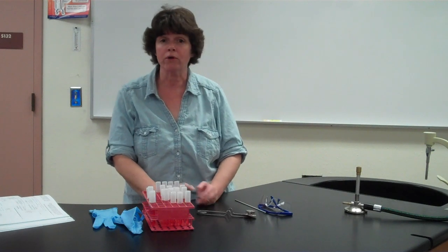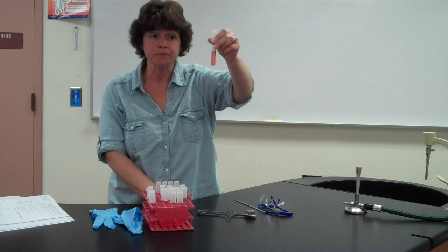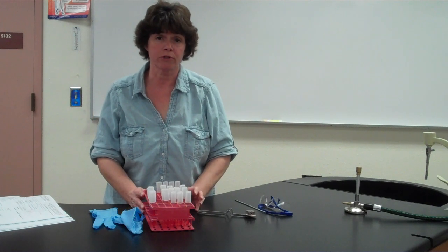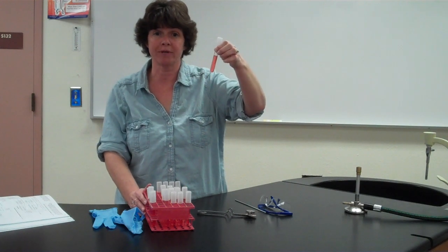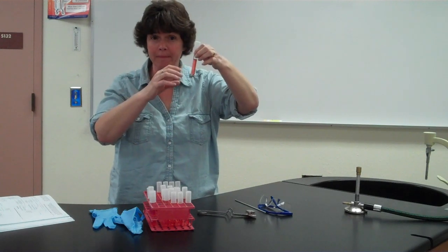A bacteria may produce acid but not produce gas, or it might produce both, or if it doesn't ferment that sugar, the tube will remain the same color. One of the things to keep in mind about all of these tests is that you want to look for growth before you ever determine results. If after the 24 or 48 hours that the tube has sat in the incubator it's still red, the first thing you want to look for is turbidity. Look for whether there is a pellicle, sediment, or cloudiness.